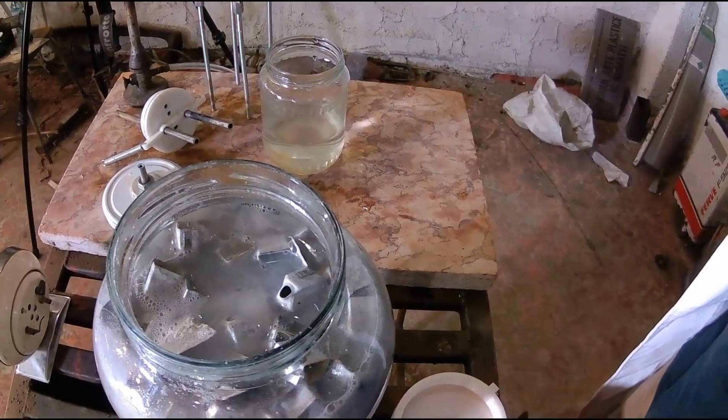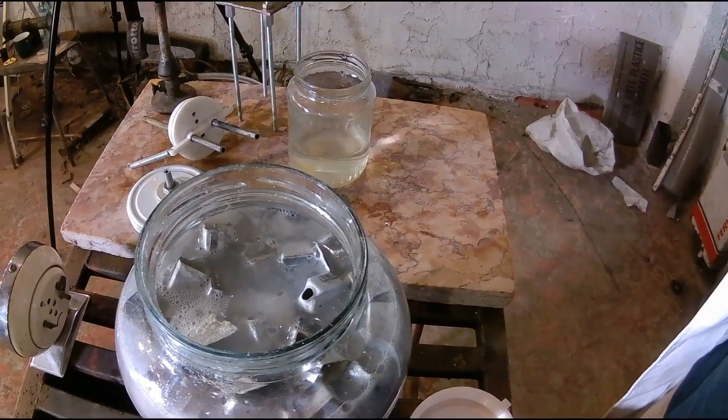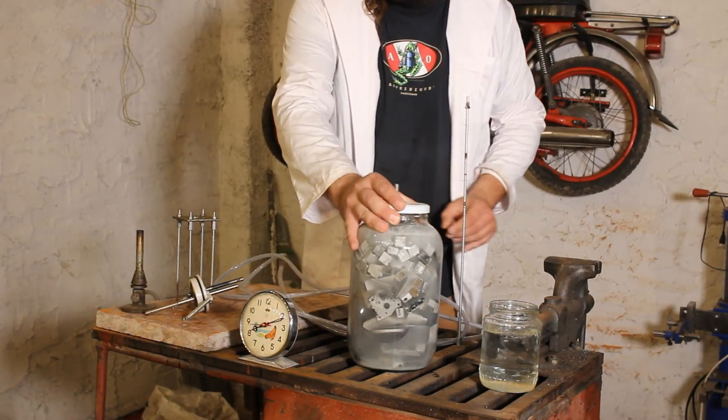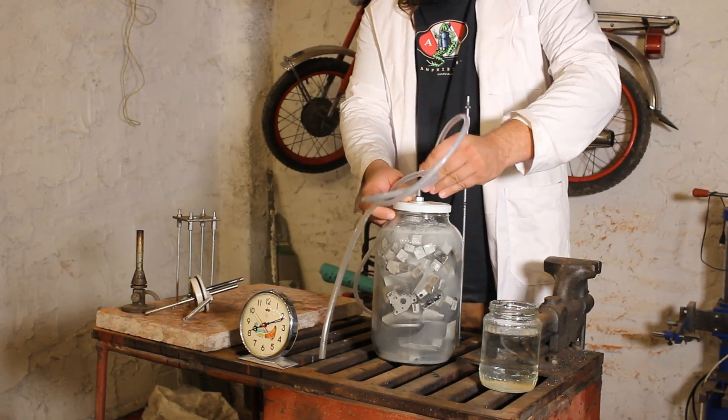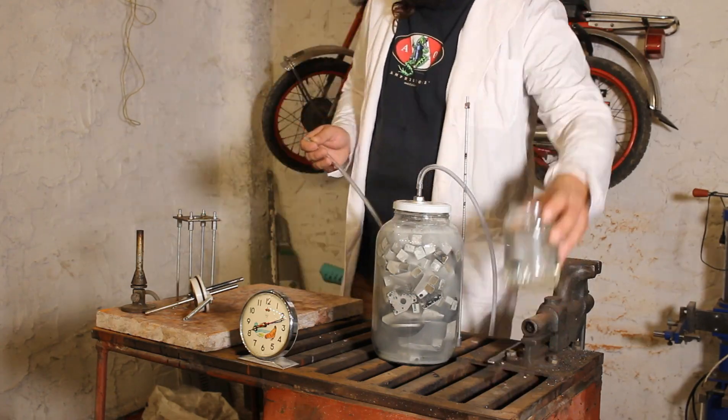Here is a close-up of the jar. As you may observe the bubbles have already started to form. Now that I get the reaction going it's time to assemble the rest of my device.